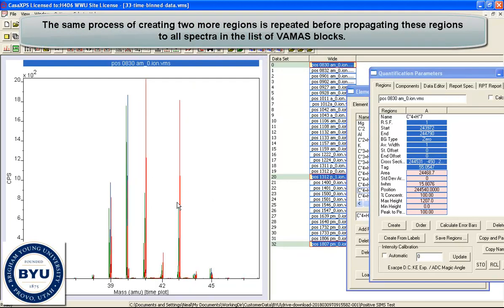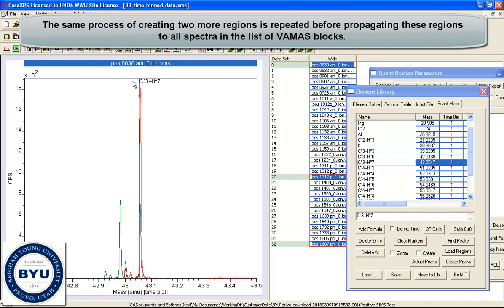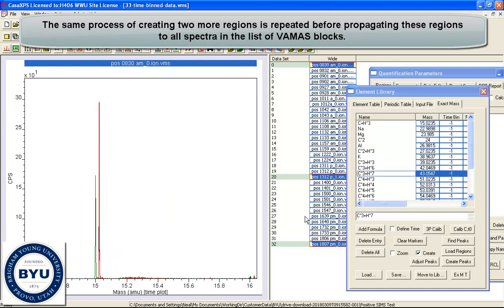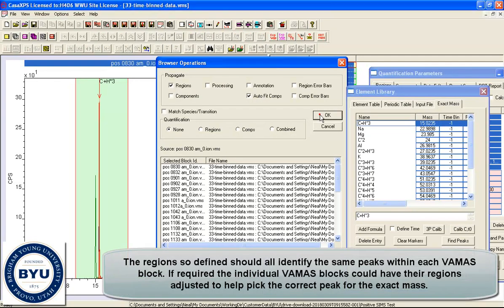So let's go for this region here, and on the exact mass calculator we'll untick the create so we can interrogate these. So that's a peak which is C3H6, or we could try C3H7. Let's have a look at that one. Okay, let's try this one. So let's create, and again we need to define the limits so that it encompasses all the peaks for which the peak maximum must be determined. And then one more. Let's go for this one here. So we've got the CH3. So having defined these regions, we'll now propagate the regions to all of these spectra.